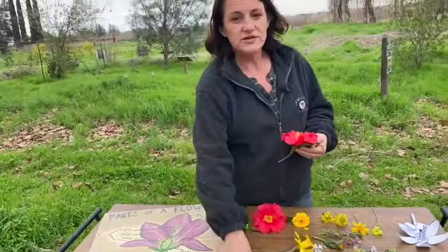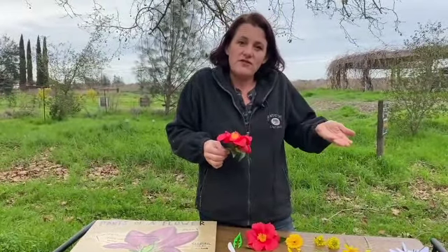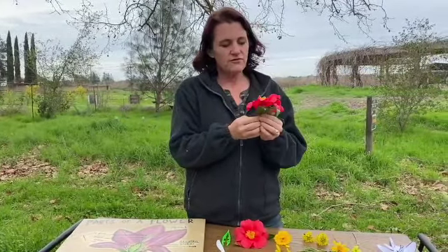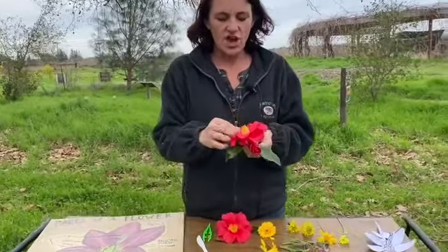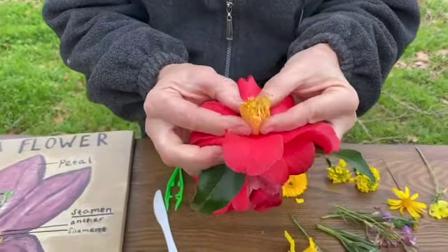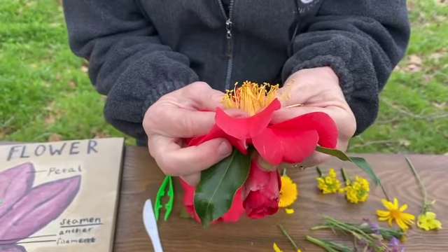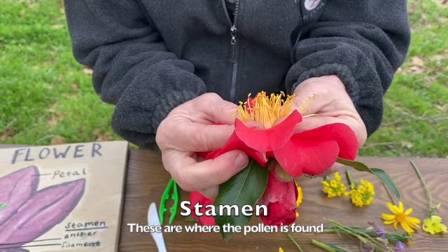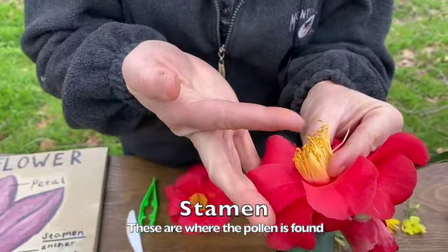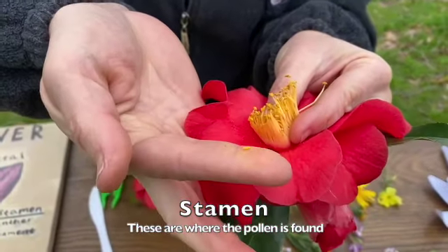I want you to know that some flowers make it really easy to find these parts, and other flowers are definitely more challenging. So I think we'll look at this beautiful pink flower first and take a close look at what we could find. I do see, look at all of those. Those must be the stamen. And look at how you can see on the end. Let's see if we can get any pollen on here. I don't know if you can see on my finger. It's kind of hard to see. I'll push a little harder, but see all that yellow powder?